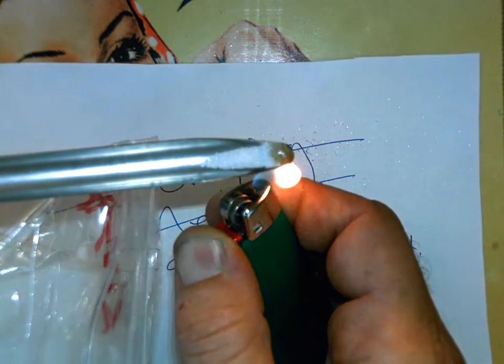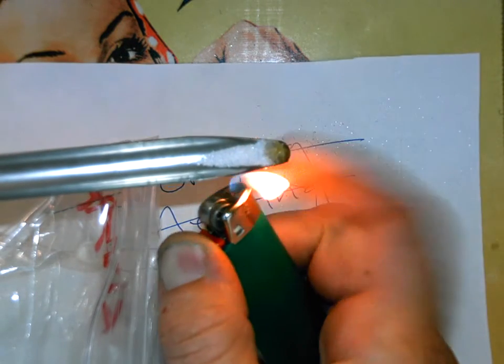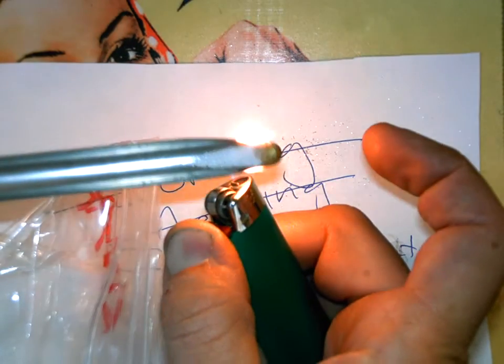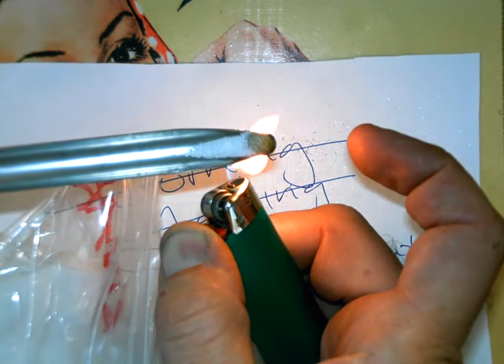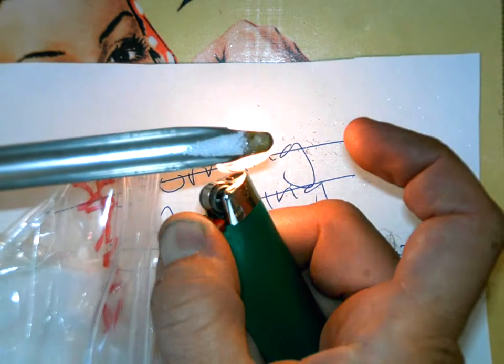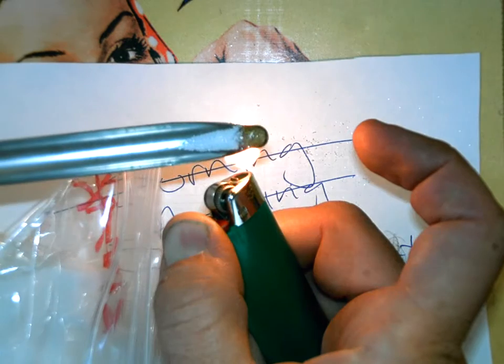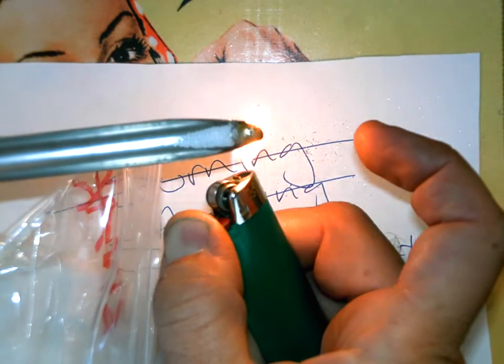very long for it to melt, beginning to bubble, and it's starting to turn brown, starting to cook. It's basically turning into a caramel now, I guess. Anyway, look at how very quickly the sugar melted. Covalent compounds have low melting points.